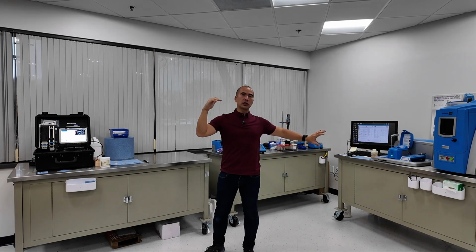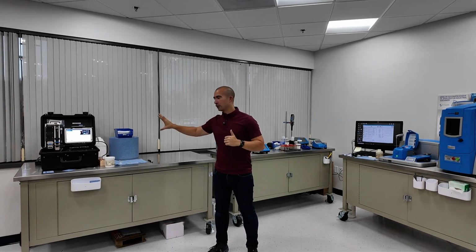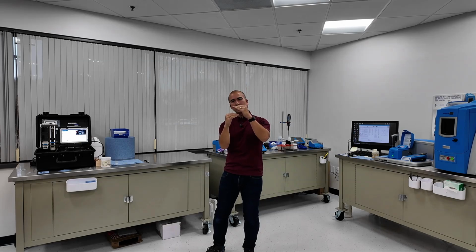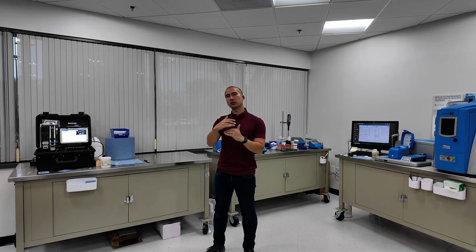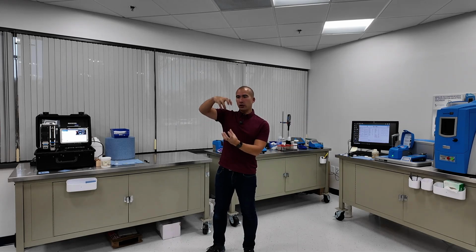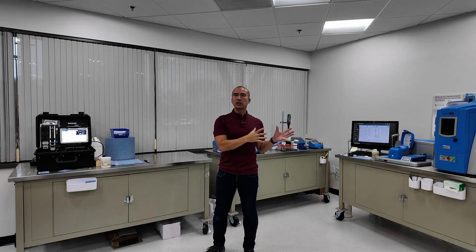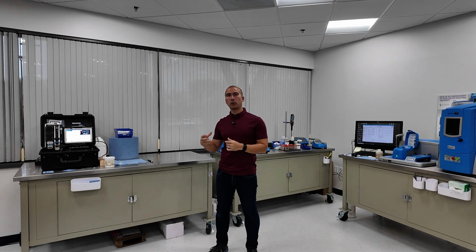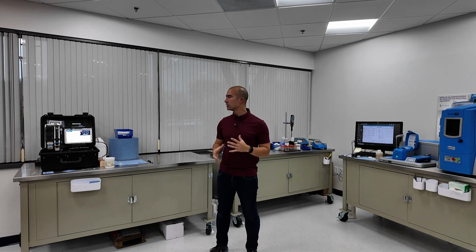Then you'd probably argue that these units over here sit below that, which is a lab that you have set up on site. Then underneath that sits third-party lab analysis, and then below that is your exception testing that you might do at a specialized lab. So again, we've got to construct that pyramid and decide which analysis is appropriate for which application. And I fully expect that over the next couple of years, we'll move into a mode where most sites are using a combination of all of those five. That's really where I'd like to see industry get to.